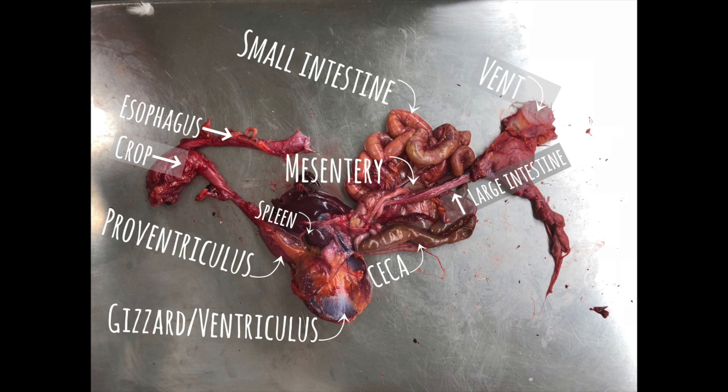The gizzard then has thick muscular walls with a sandpaper-like inner surface. It grinds hard materials into a fine paste. The small intestine is where most absorption of nutrients takes place. It is made of the duodenum, jejunum, and ileum. The duodenum secretes bicarbonate to neutralize pH. The mesentery attaches the small intestine to the dorsal abdominal wall and supports arteries and veins.